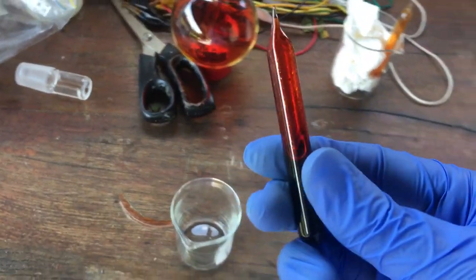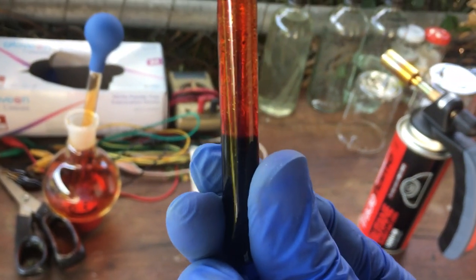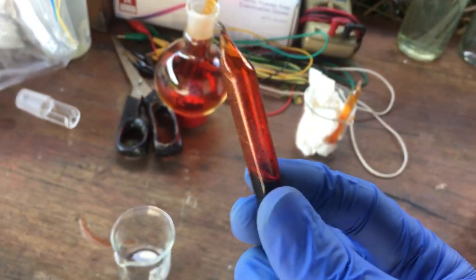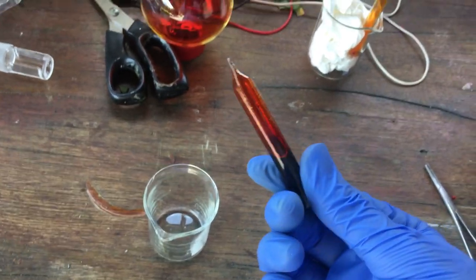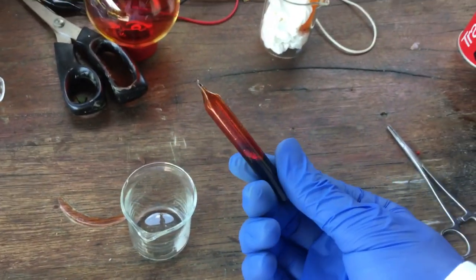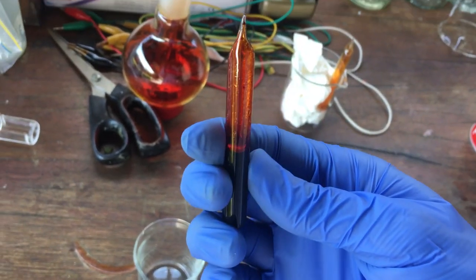So, very cool. You'll notice that the bromine sticks to the glass quite considerably, and there's even a tiny little bit of water on top of the bromine, but I don't have the concentrated sulfuric acid to get rid of that, and I don't really care. I mean, this is good enough for me. I'm proud of this bromine.